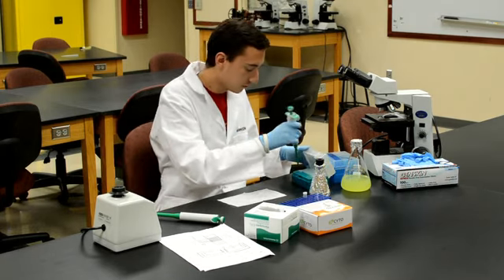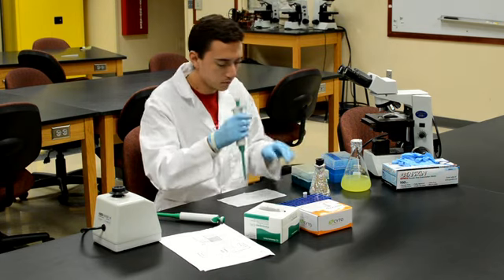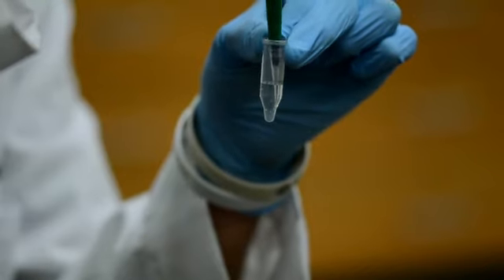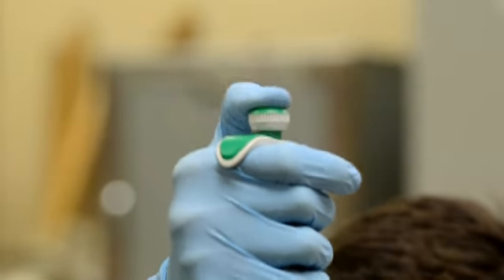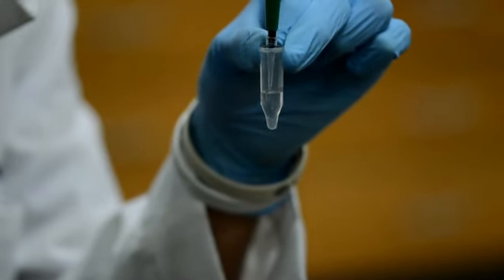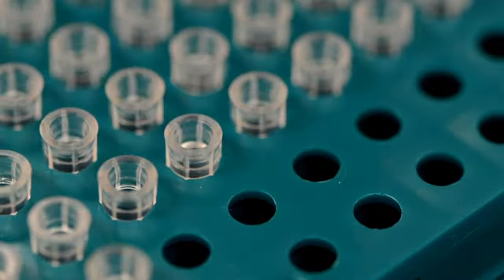Now that we have mixed our iodine into our sample we need to remove the cells that are stuck to the sides of the centrifuge tube. We do this by scraping the sides of the microcentrifuge tube while quickly pipetting up and down. This scrapes the cells off of the wall and the pipetting blows them off the pipette tip. Without this step our count will be inaccurately low. Do not rush this step.